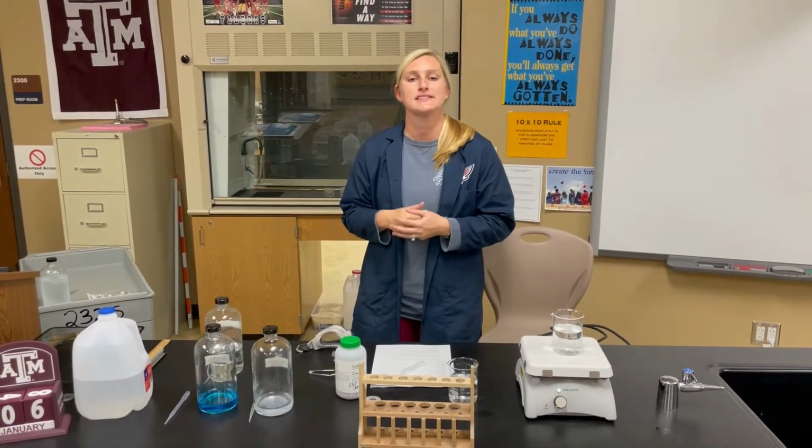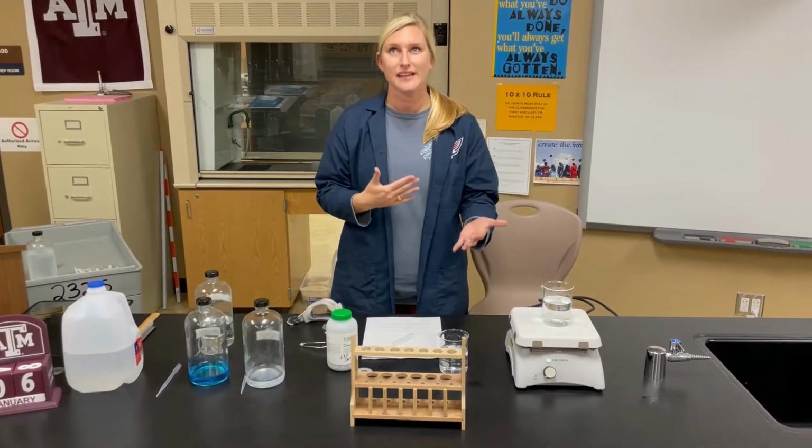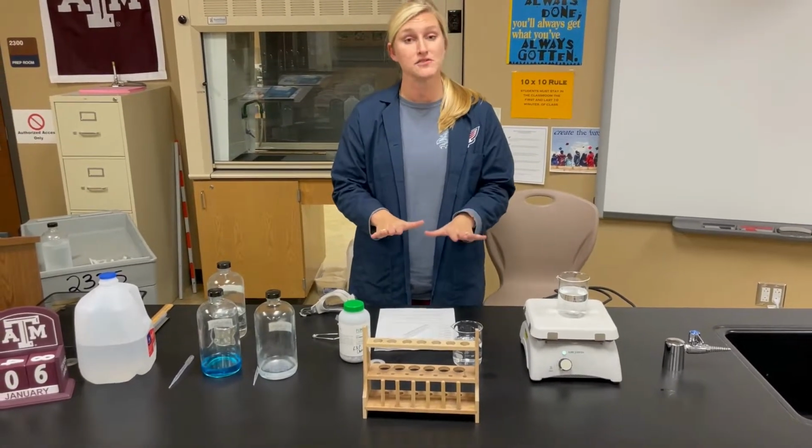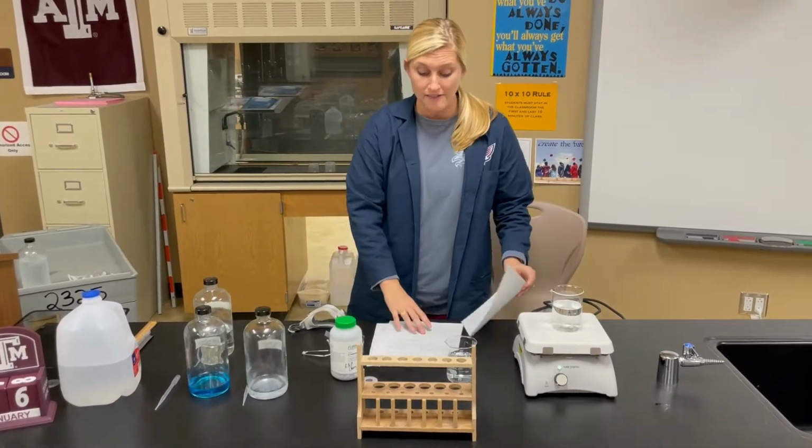Now we're going to be doing this as a demo because there's a bit of time sensitive stuff in here that, if we did it live, wouldn't really work. So I'm going to go through each of the reactions individually and then we're going to put it all together at the end. So you should have in front of you two things.